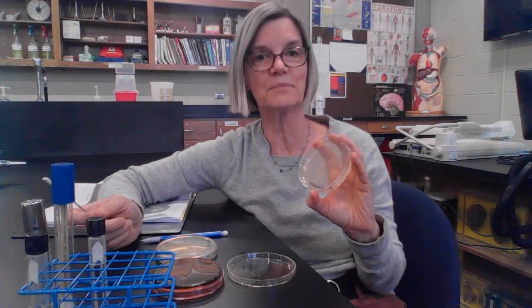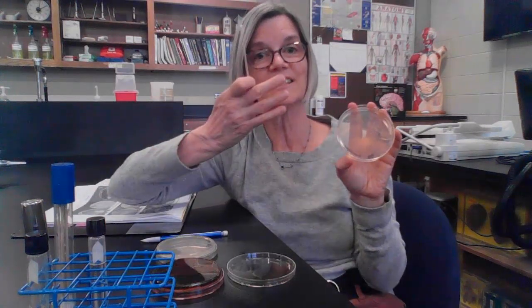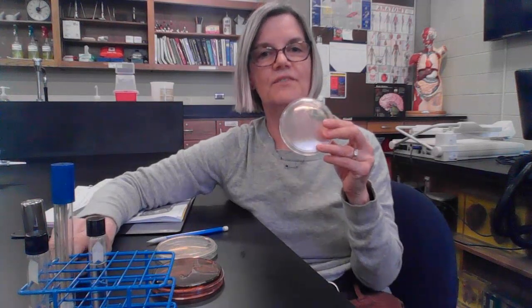Now, using good aseptic technique like you would do in a clinical setting or in a lab setting, I want to make sure I'm not facing it at me. I want to make sure I'm not talking on it, because I can spray aerosols and other bacteria. I'm going to close this right away when I'm done. And I have a discard for my swabs. And I'm going to do that on each of these plates.